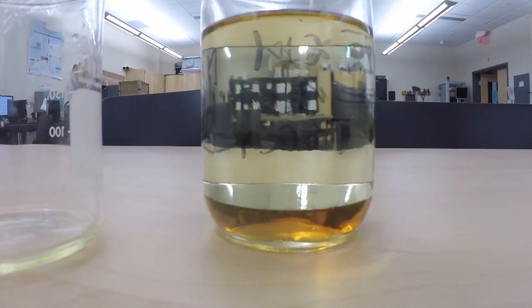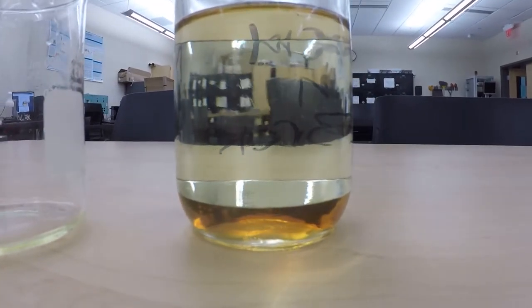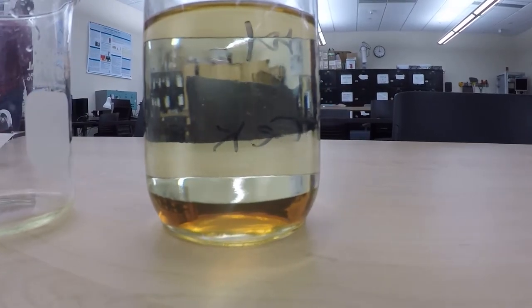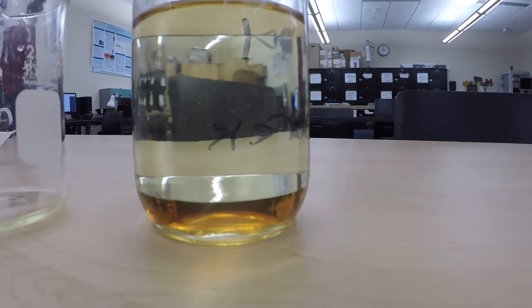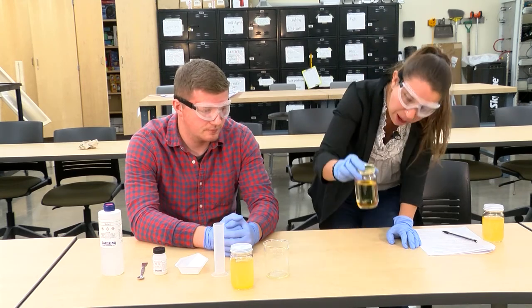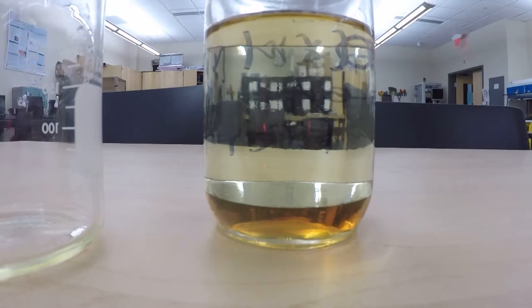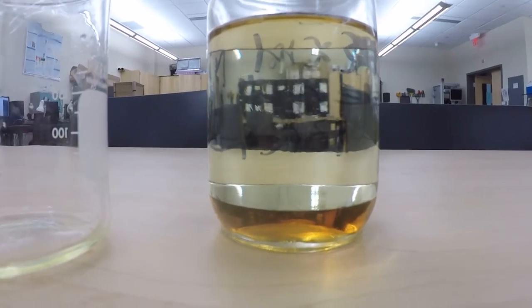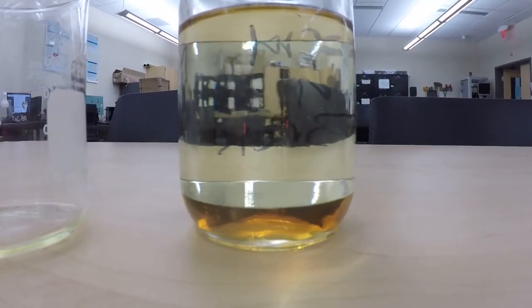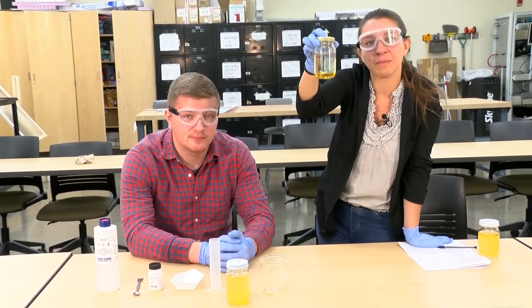What we have here, we've got two layers. That first layer is our methyl esters — these are our fatty methyl esters as they're called. And right there at the bottom, that slightly darker layer, that is our other product. So what was the other product from transesterification? It was glycerol. This is the glycerol at the bottom.